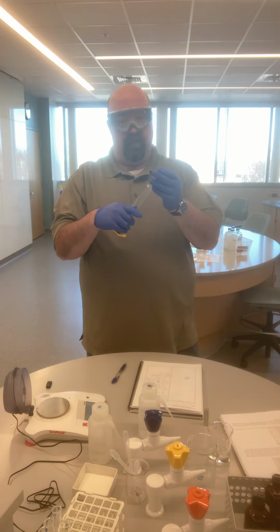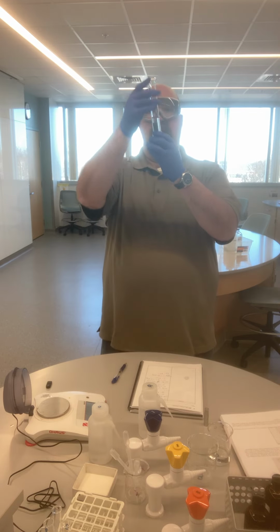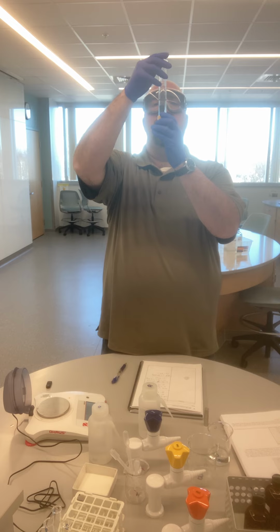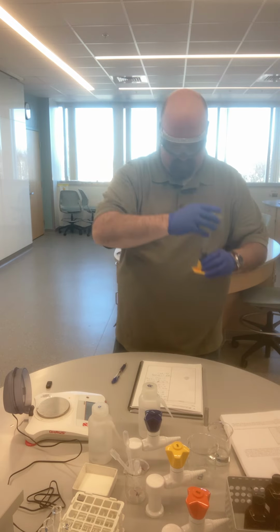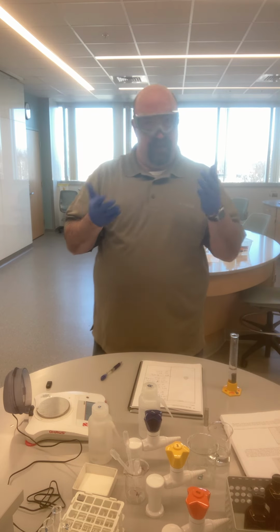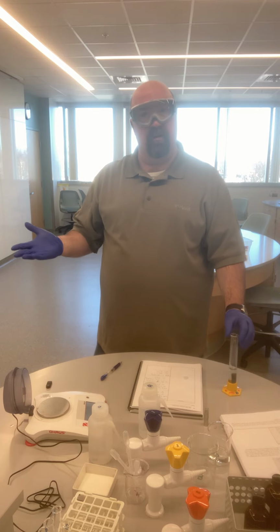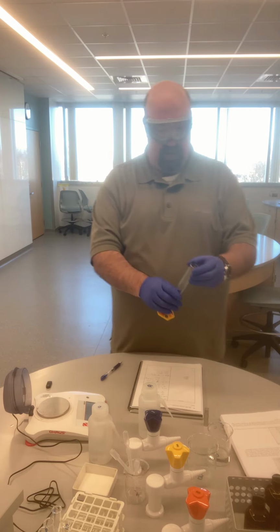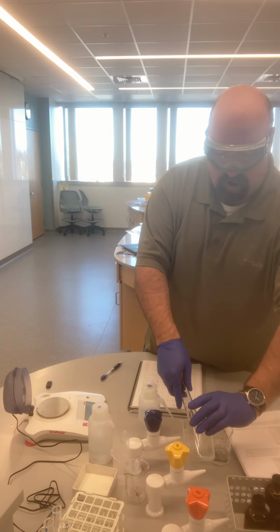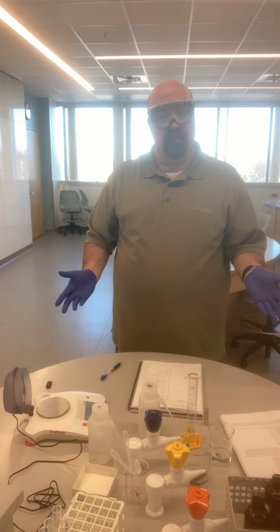And then I'm going to carefully, so none splashes out, add in my metal and record the new volume of 25.0 milliliters. The difference in those volumes between my initial and my final, that is the volume of my cylinder. And so now I have the mass of the cylinder, I know the volume of my cylinder, I have all of the tools that I need to find the density of that cylinder.